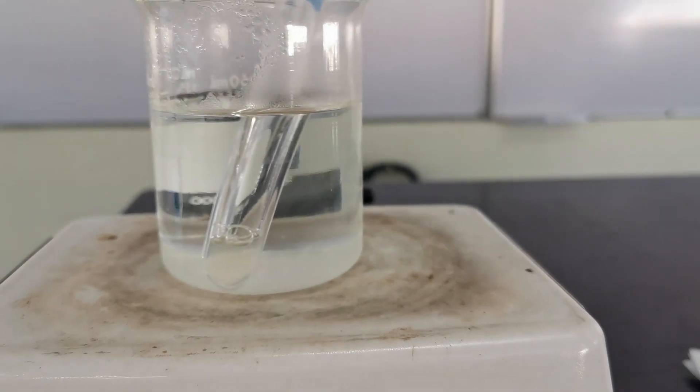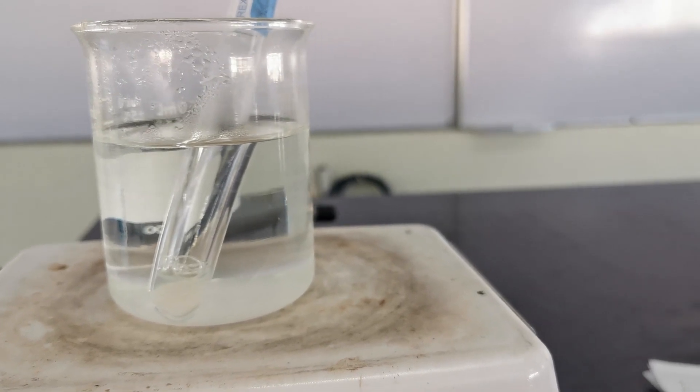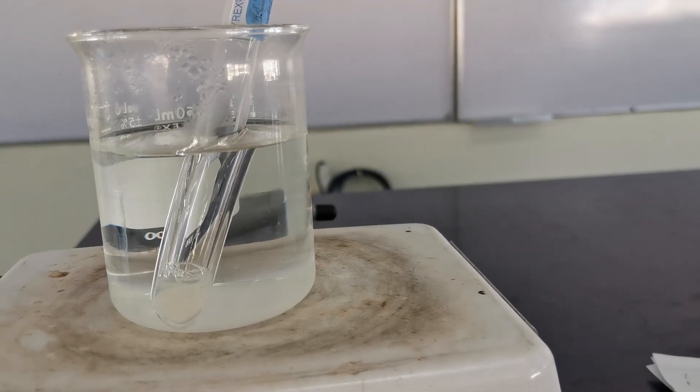Heat to boiling using the hot plate. Afterwards, allow to cool and observe the color produced.